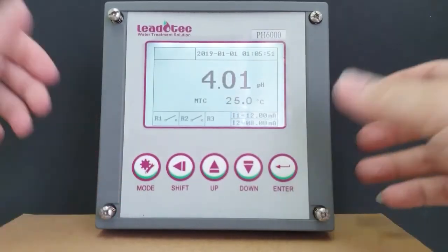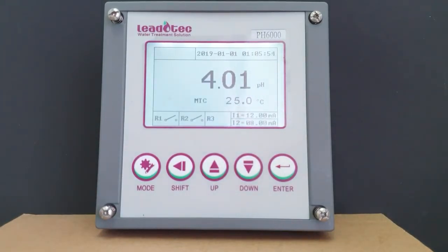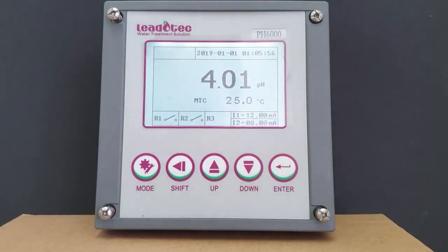So now you have a well calibrated pH controller. Thank you so much for watching and have a great day ahead. Bye-bye.